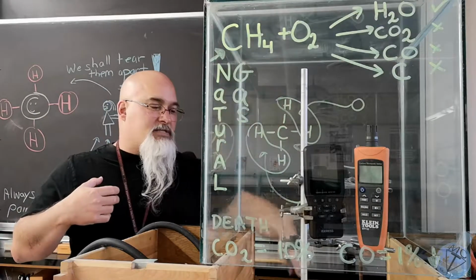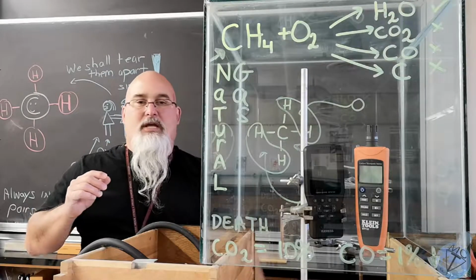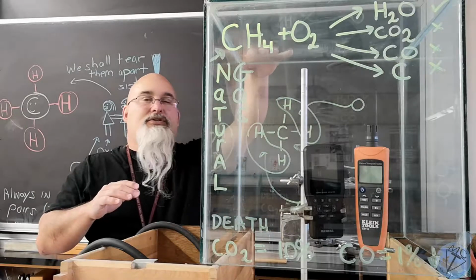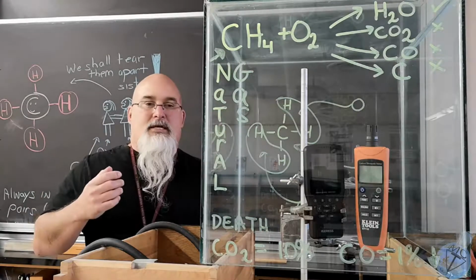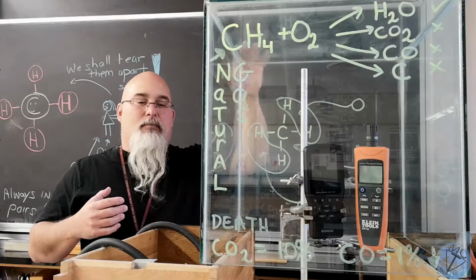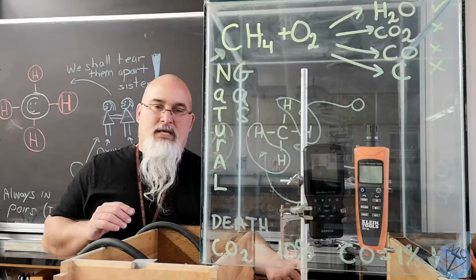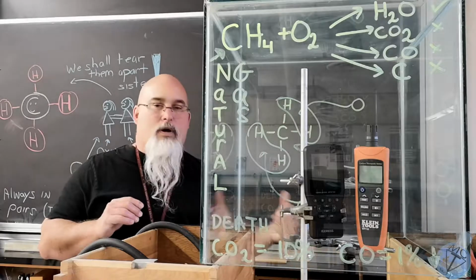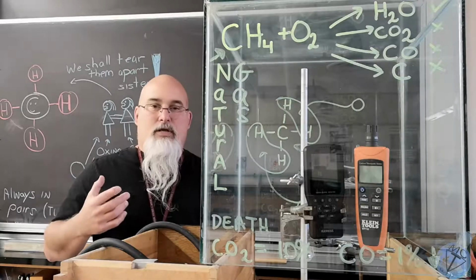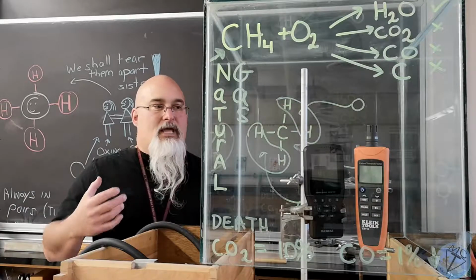The burner I've got set up down here, and we're going to vent it into this upside down beaker. There's no reason for that beaker other than it's shielding the top of the container from a little excess heat. That beaker is Pyrex. It's much more heat resistant than the tempered glass that the container is made out of. So it's just a shield. And you're going to see, even with plenty of airflow underneath here, we will still accumulate a toxic level of gases fairly quickly from such a small flame, and then we'll discuss where it comes from in our daily lives.